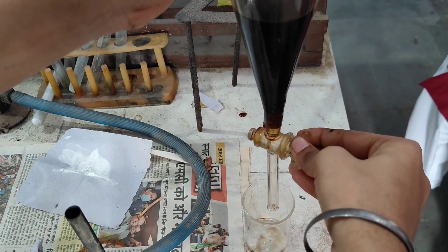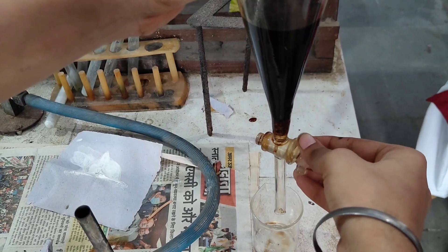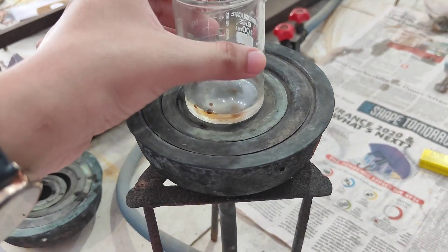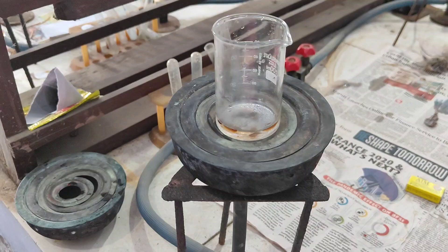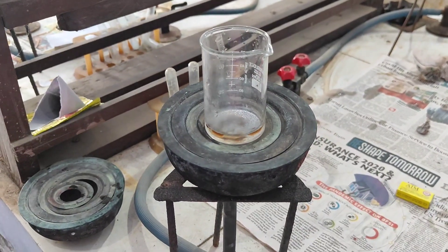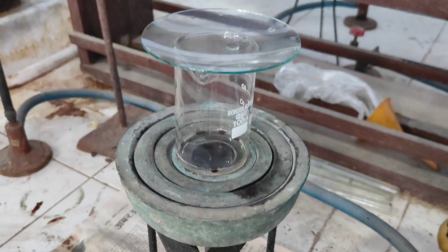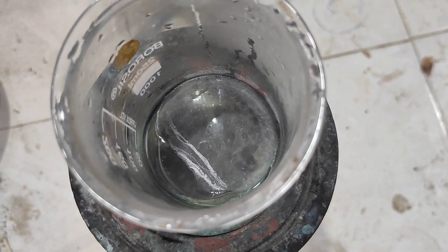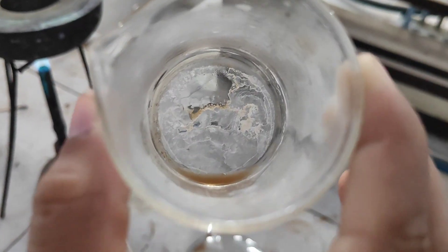After we separate the total caffeine-containing layer, the rest of the solution is discarded. We place the caffeine solution on a water bath to evaporate and reduce it. We can then see a small white crystal or powder form of caffeine — this is the extracted caffeine.